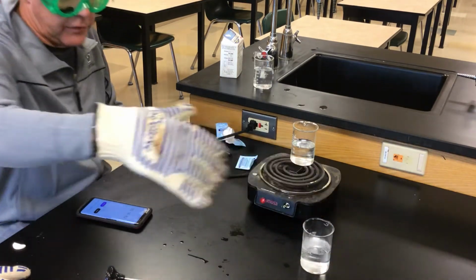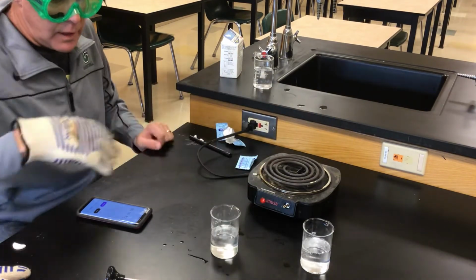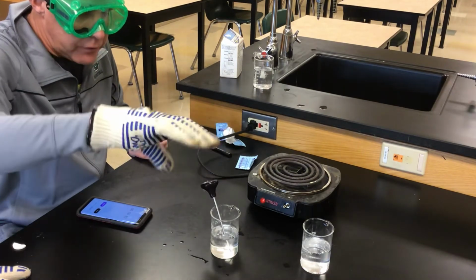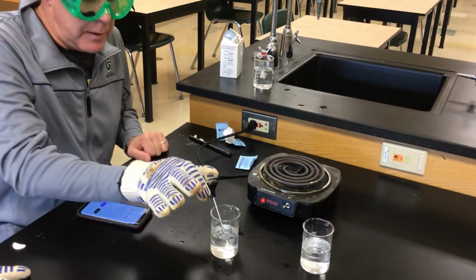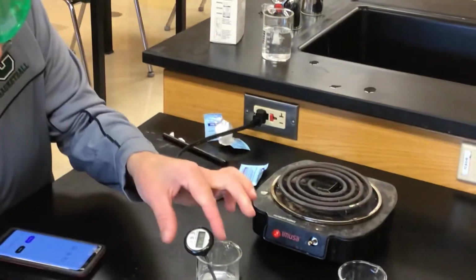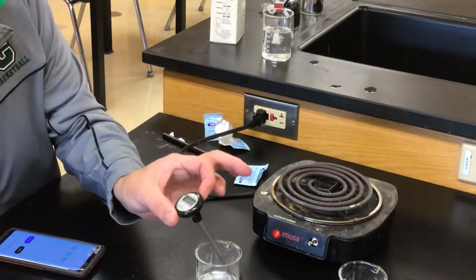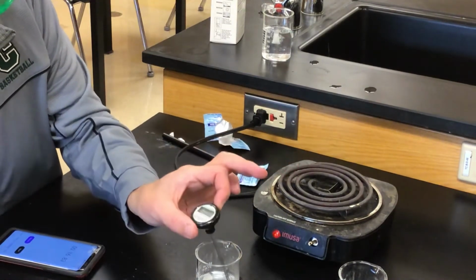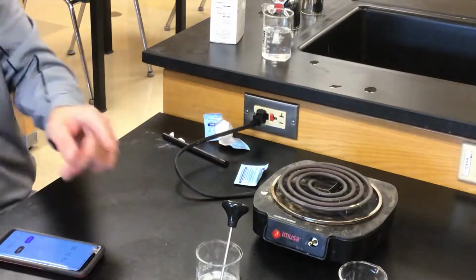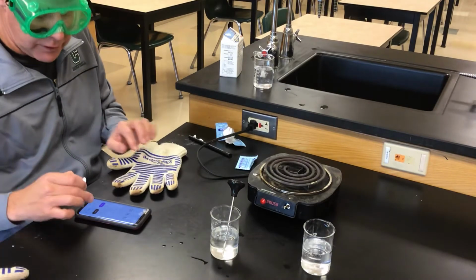And like I said, I'll do that 3 more times. I'm just not gonna do it on video. This other one I had sitting here has been heating the whole time. And that temperature, I don't know if you can see it, looks like about 72 degrees. This is a little more precise than we actually need, so we'll just round it to 72 degrees. So we'll have to reheat. We'll have to heat this one up 2 more times to 72 degrees.